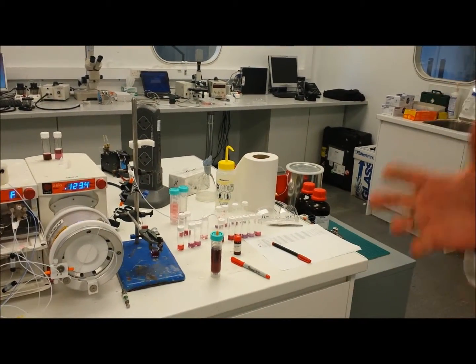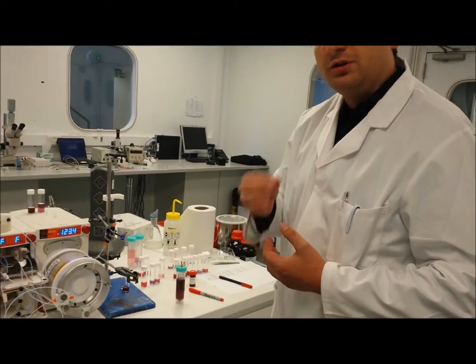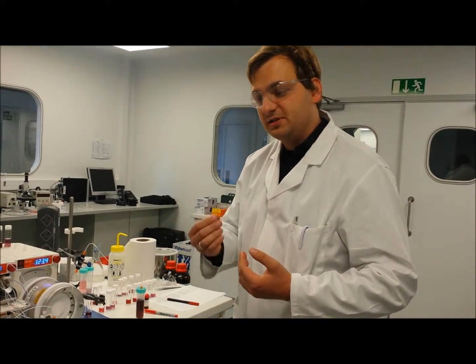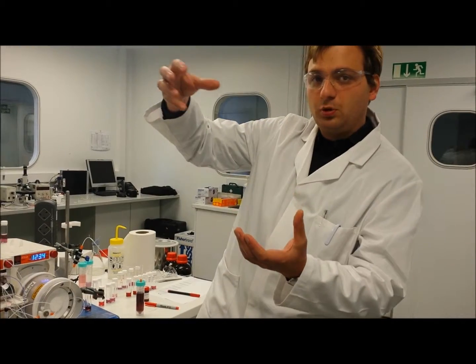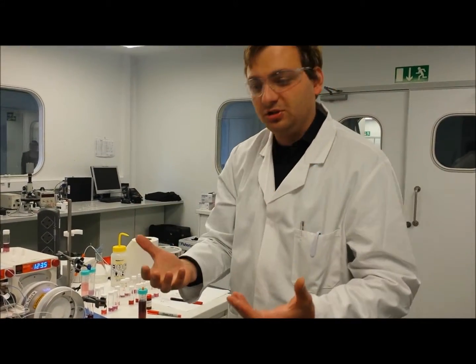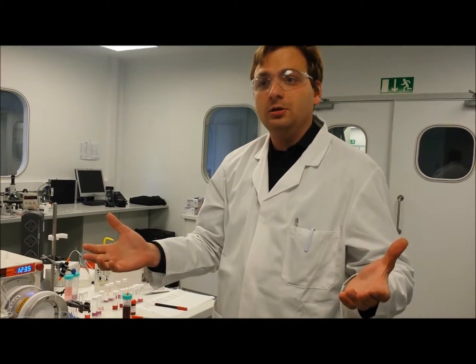Now, this enables us to do a number of things over a typical batch chemistry setup. First of all, it enables us to control molar ratios of the two reagents precisely. What you will end up doing, inevitably, if you are making a batch chemistry reaction, is you'll start adding one reagent into the other as you're mixing them. And this will create concentration gradients. This will also create temperature gradients as your mixing is imperfect and slow. And if you have a range of conditions, you will end up with a range of particle sizes.